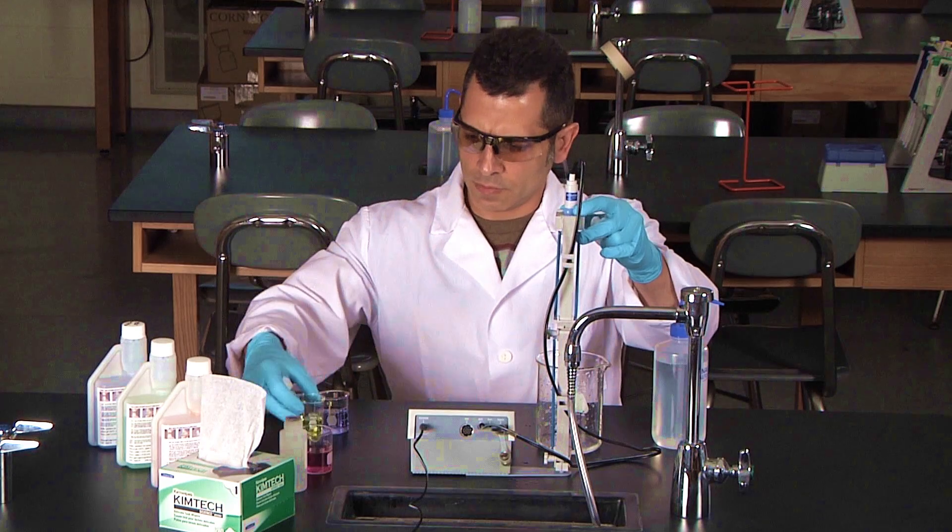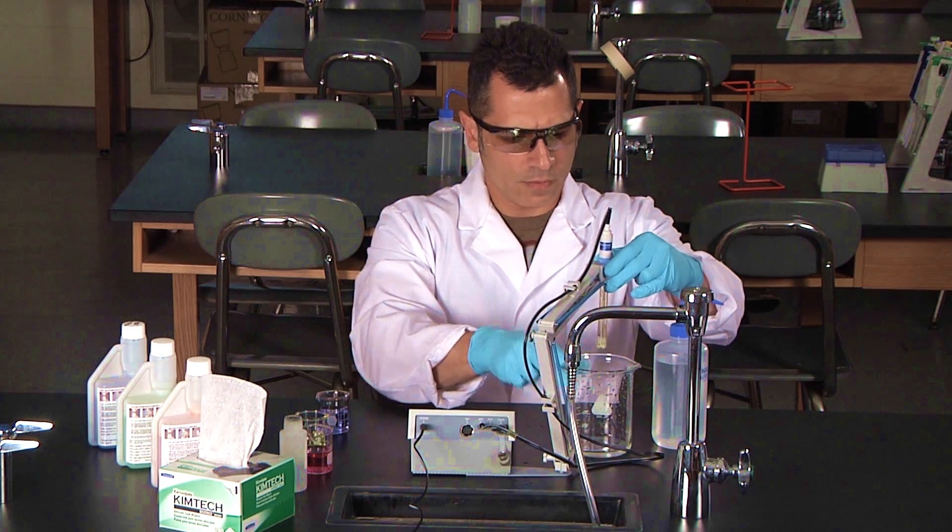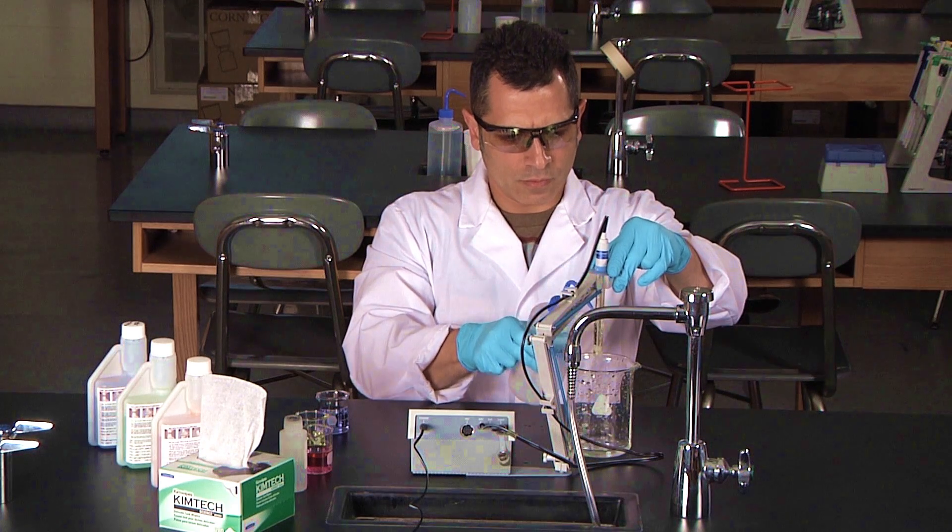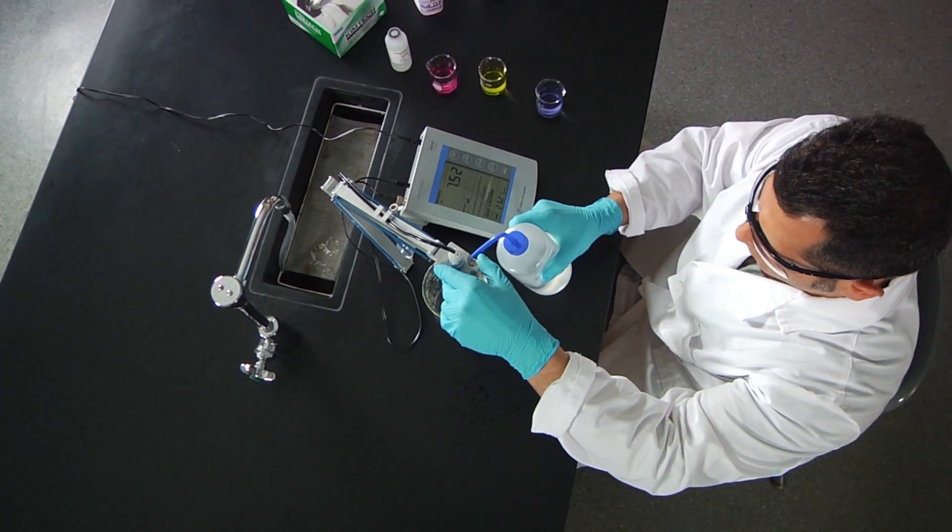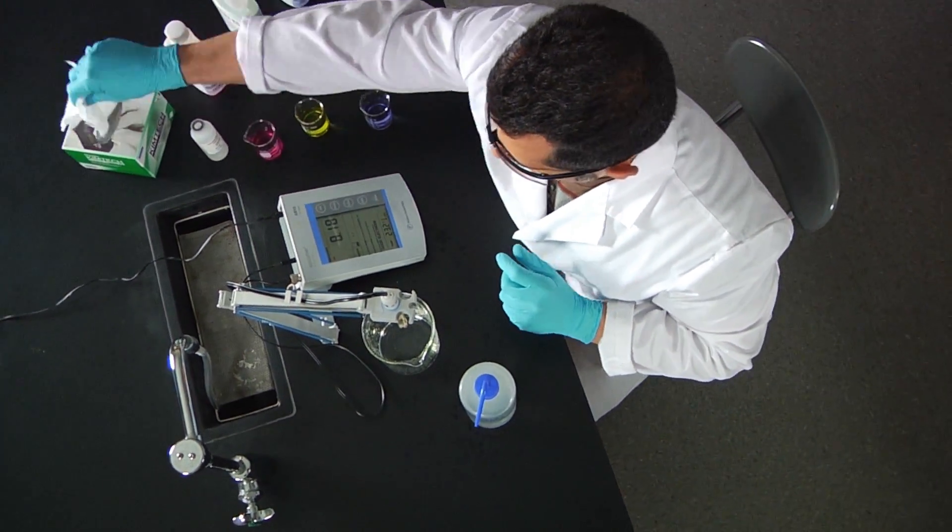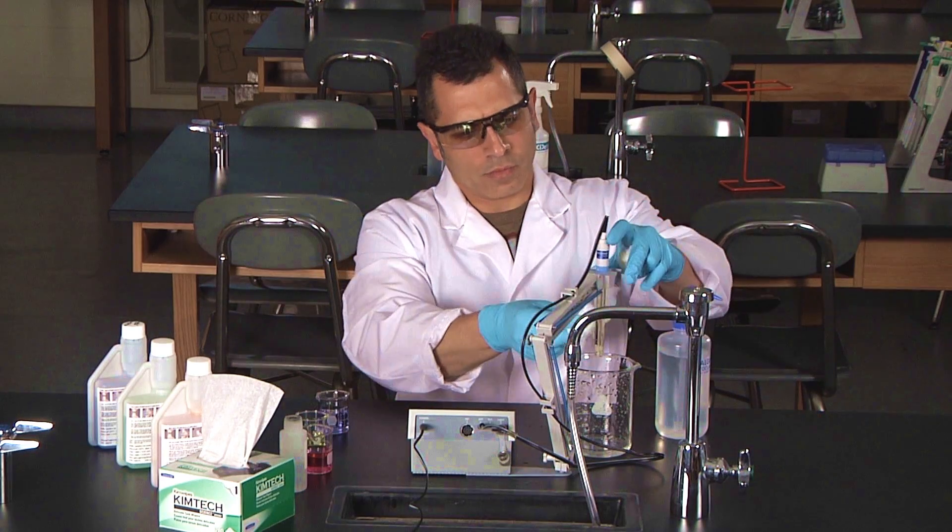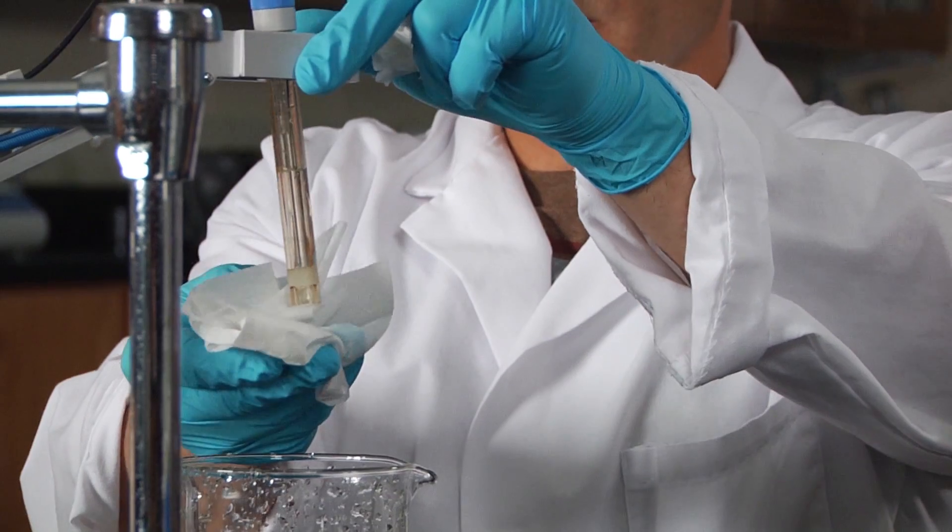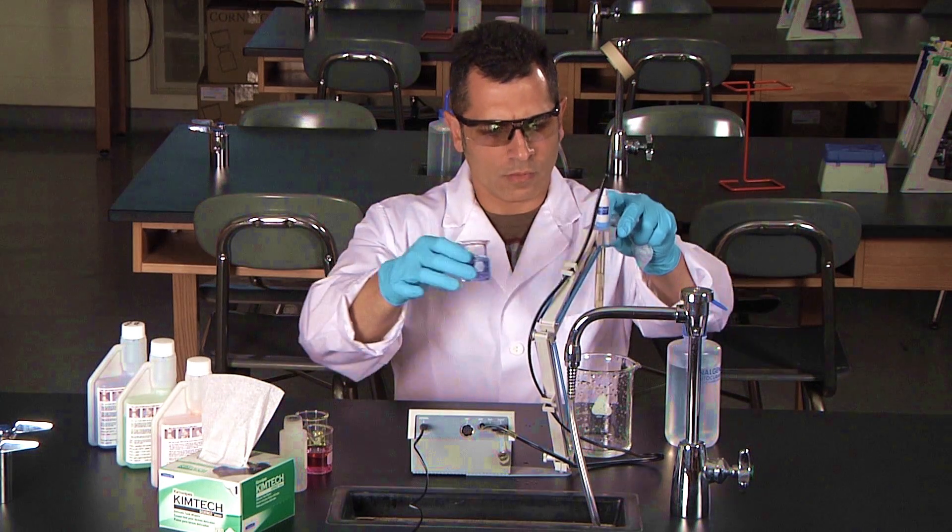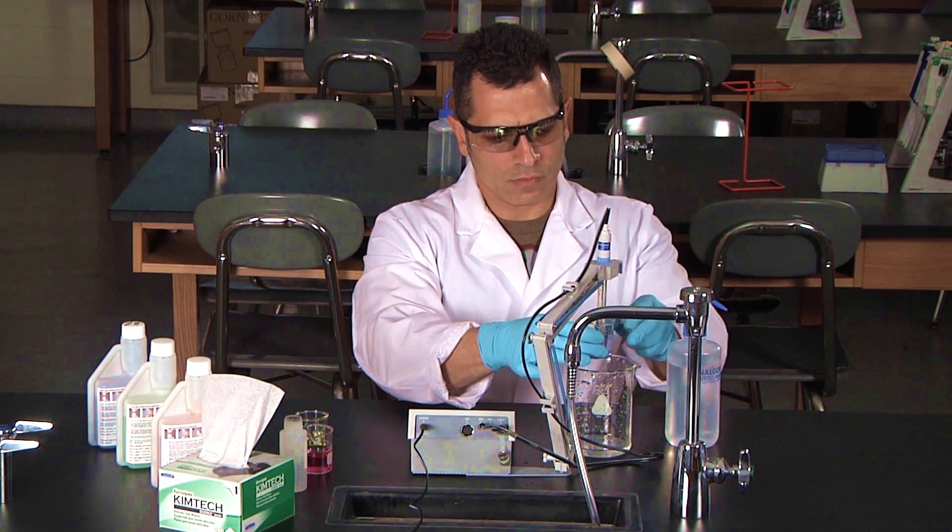Remove the probe and rinse it with the deionized water. Carefully blot the bottom of the glass bulb. Now place the probe into the 10.0 standard buffer solution.